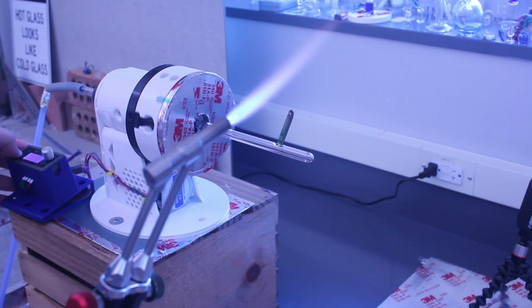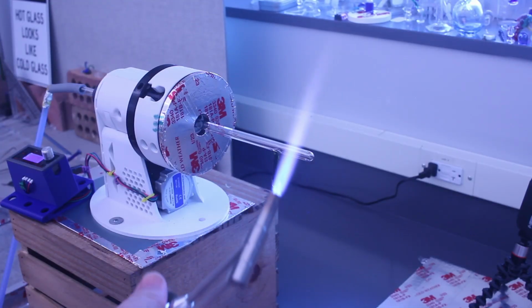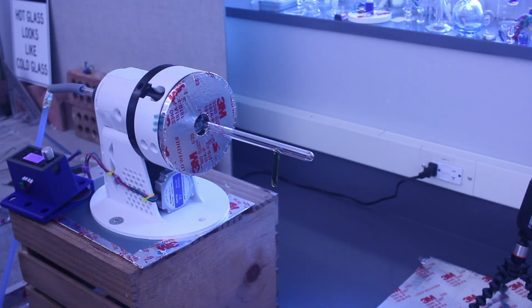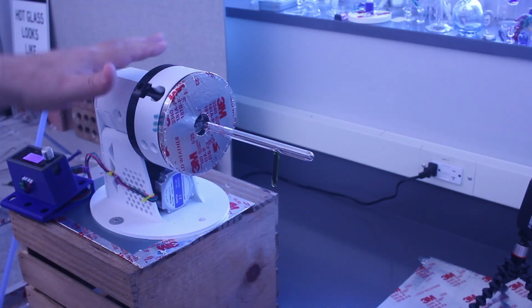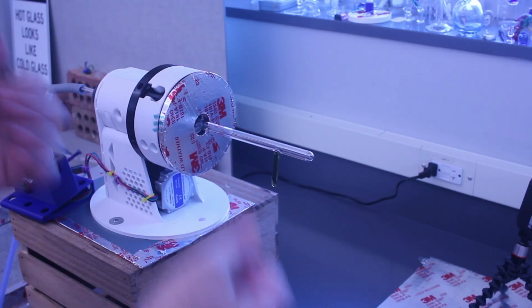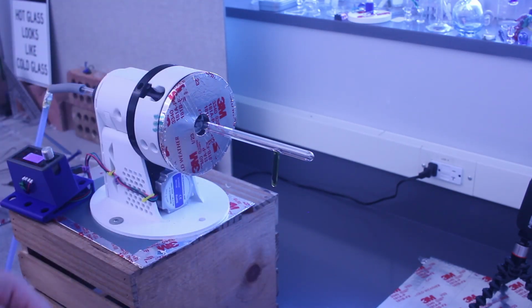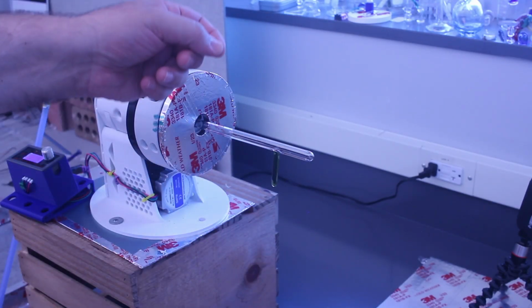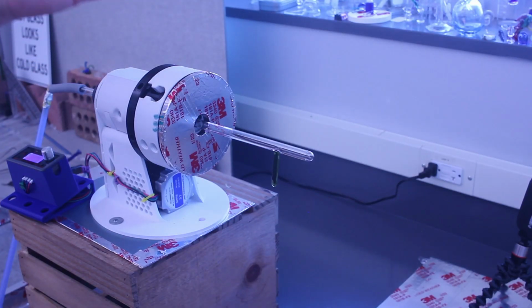So again, having the control of the lathe, where the position of the glass tube and its rotation are controlled by the lathe, allows me to manipulate the glass rod and the torch and go from there. And as I mentioned, once I've got my seal and I'm happy with it, I could come in and make another seal on the opposite side or do whatever else the project requires.